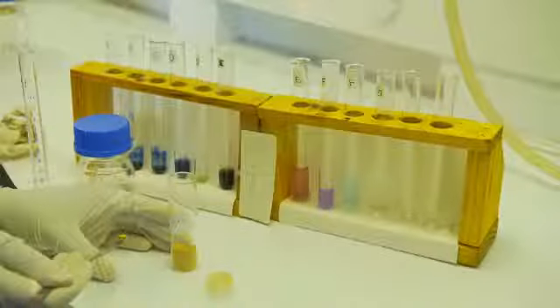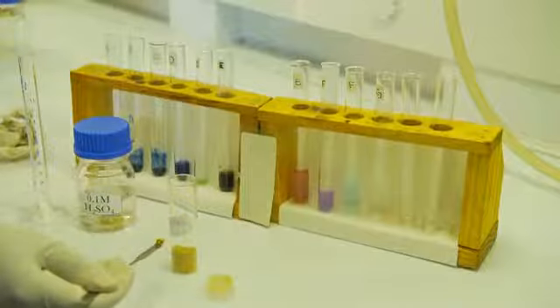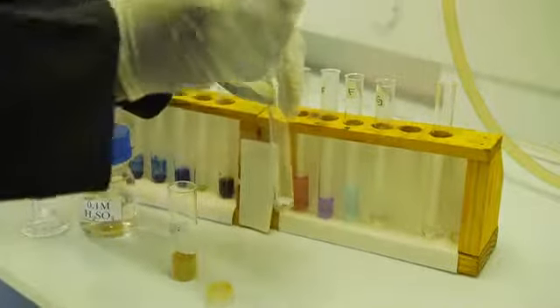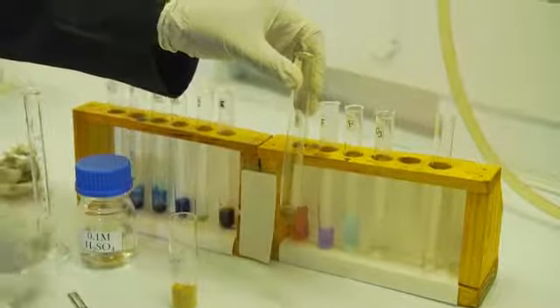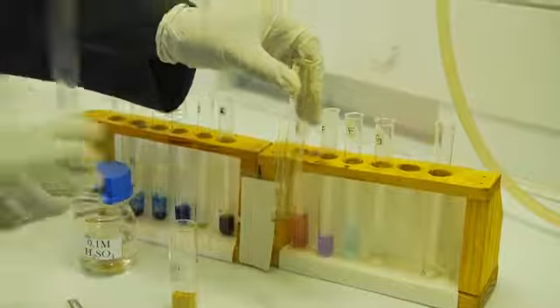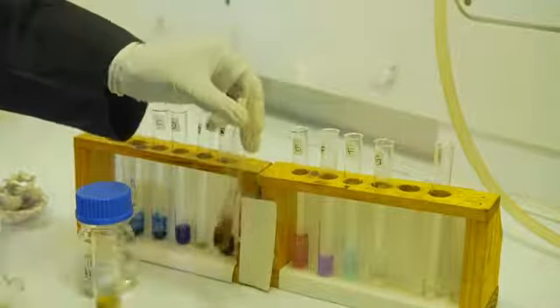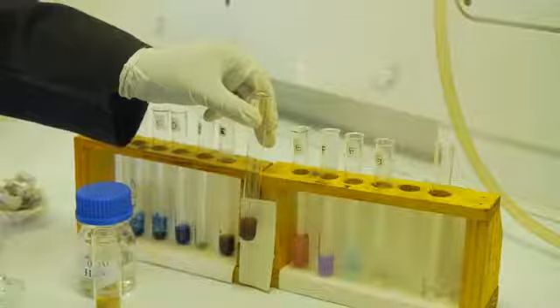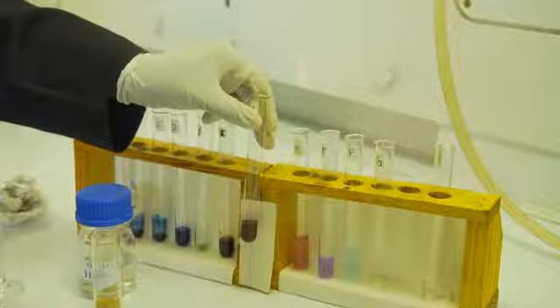To confirm the presence of manganese cations, I will be adding a spatula tip of sodium bismuthate to 1 ml of the cation solution suspected to contain Mn2+, followed by 2 ml of dilute sulfuric acid. This should result in the formation of permanganate ions, observed by the presence of a red color. This confirms the presence of Mn2+ cations.